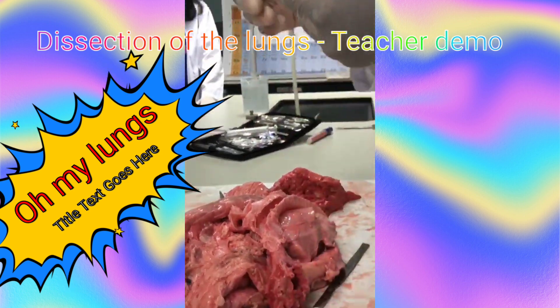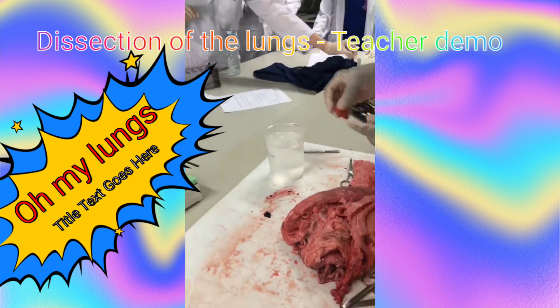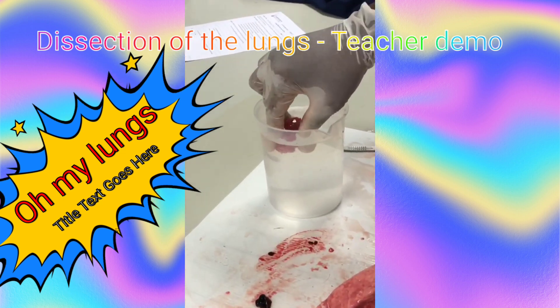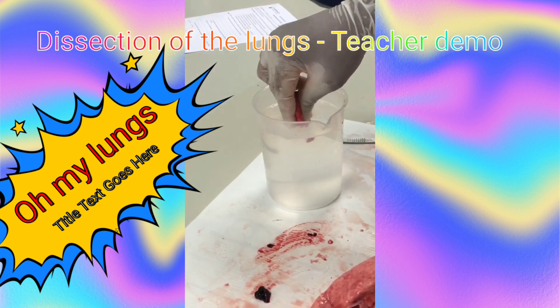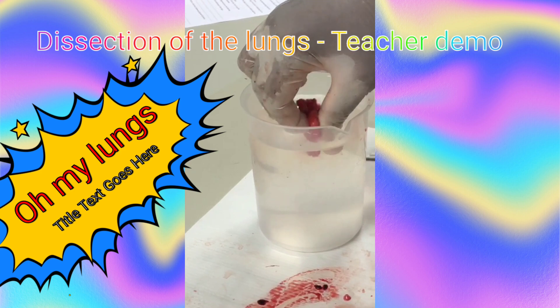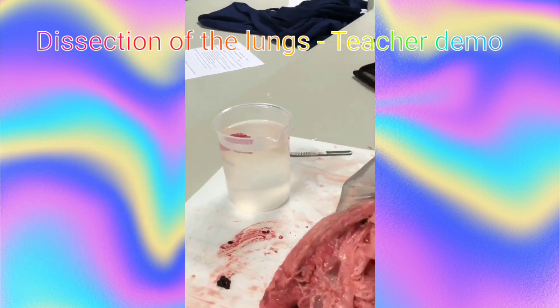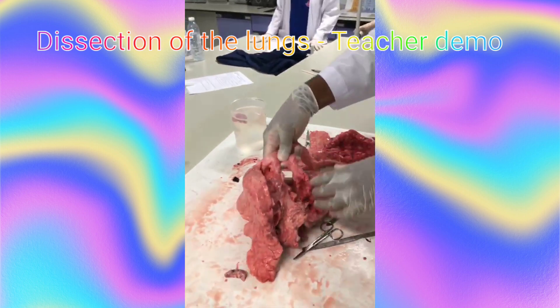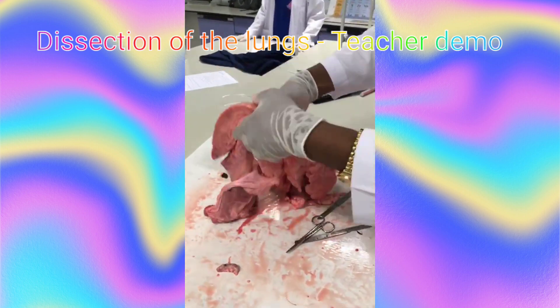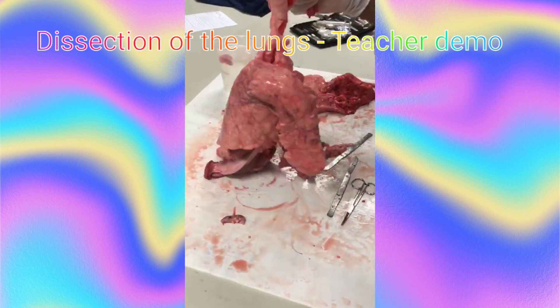In order to test that there are air sacs, we can cut the alveoli with scissors and place it inside a beaker of water. It's going to float because it's filled with air bubbles. When we press inside, we will see a few bubbles coming out from the alveoli. That is it for the dissection of the lungs. We still have one side of the lungs here, but the other side has been dissected already.